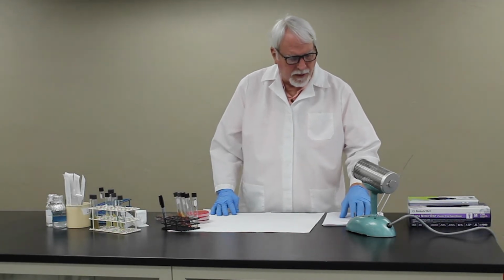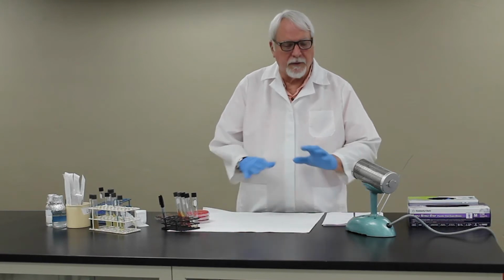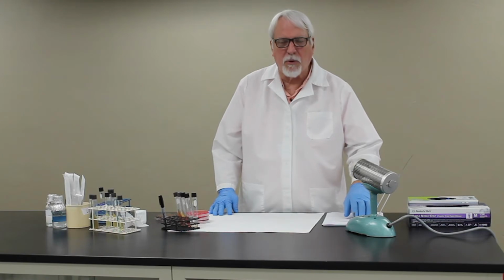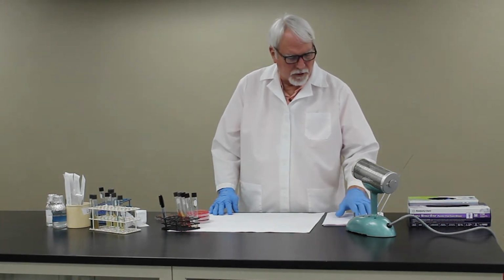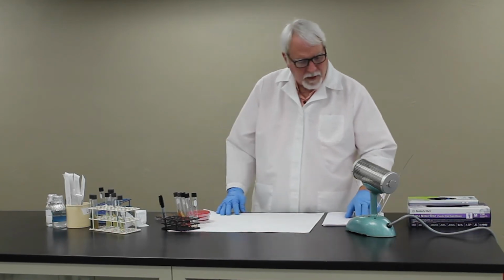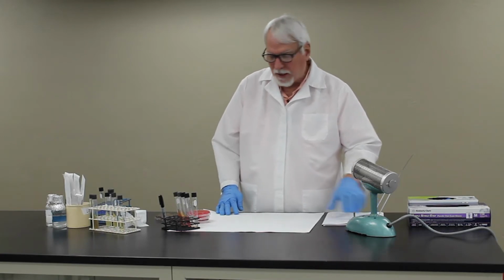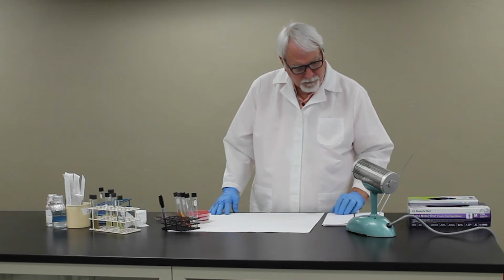They tend to be somewhat pleomorphic as well, meaning they're going to have different shapes to the cells. So it's really important for this lab to look at the gram stains, to look at your cell morphology, and then also to look at your growth on your blood plate to see the colony morphology. So we'll have photographs of all that on your Moodle site that you can take a look at.